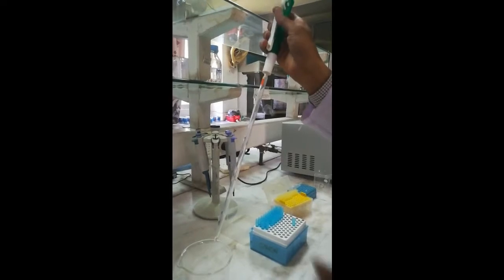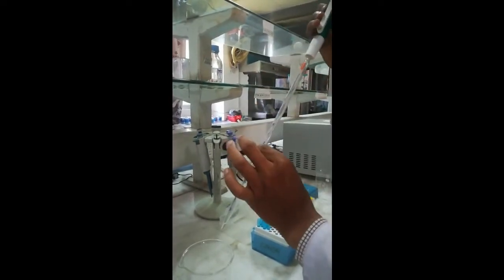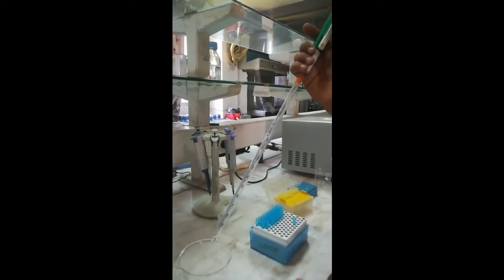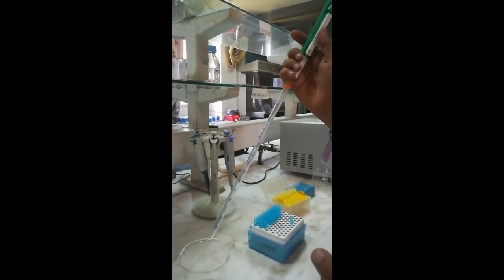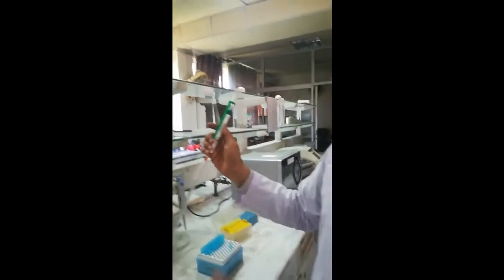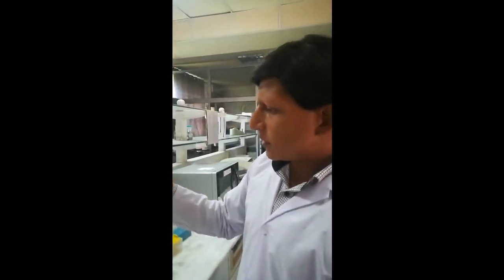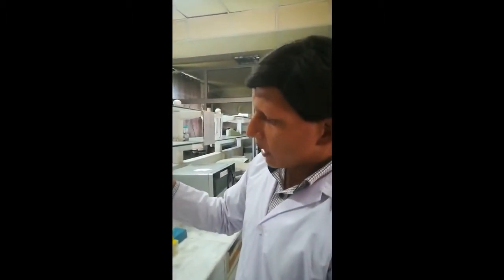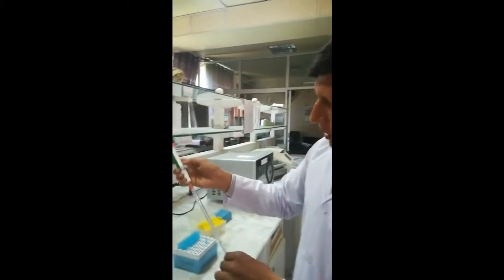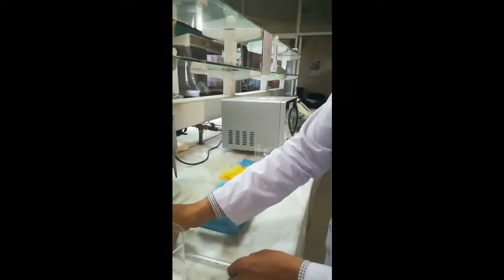Besides the pipette pump, there is another gadget that can be used — a vacuum pump. A vacuum pump can also be attached with this pipette to suck the solution. There are also other types of pipettes known as micro pipettes.